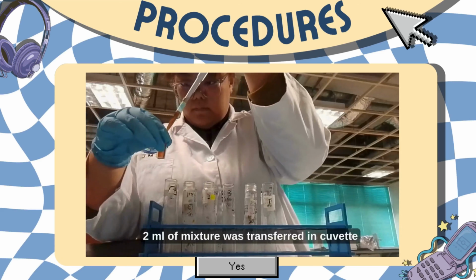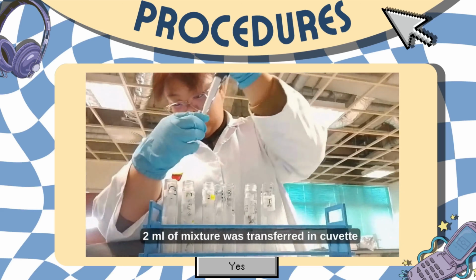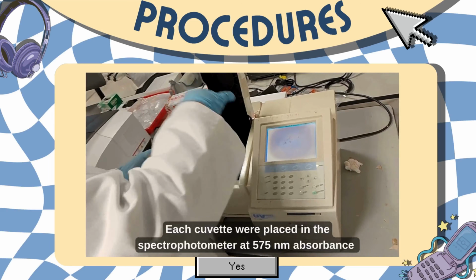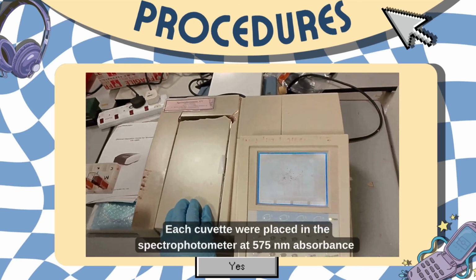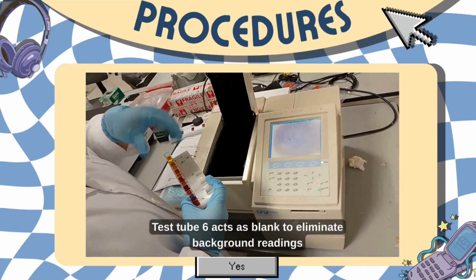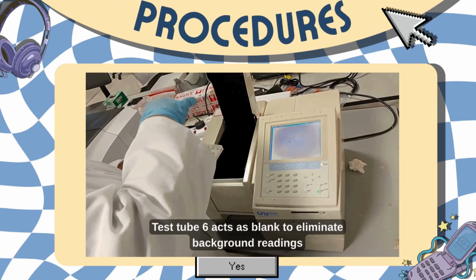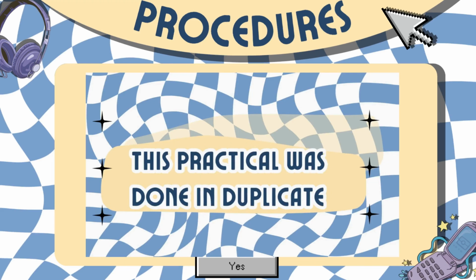Then, 2 ml of each of the mixture was transferred in the cuvette. Each of the cuvette were placed in the spectrophotometer at 575 nanometer absorbance. The test tube 6 will act as a blank to eliminate the background readings. This practical was done in duplicate.